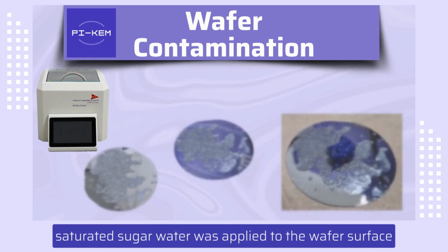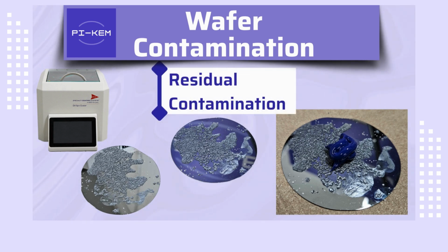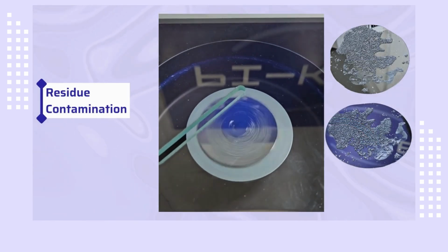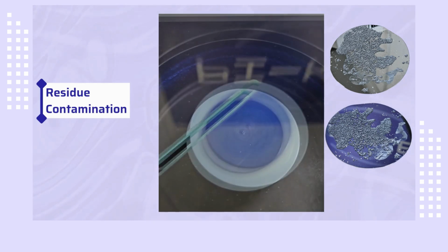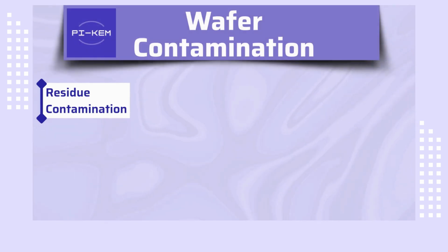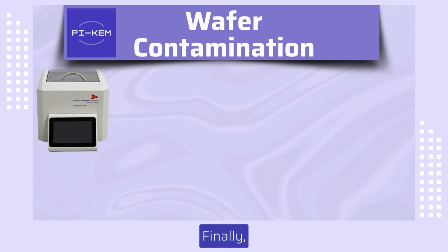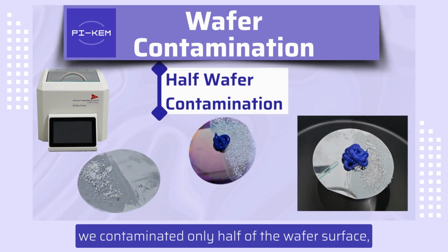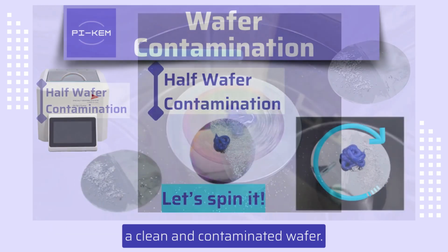Secondly, saturated sugar water was applied to the wafer surface and allowed to dry. This represents residual contamination of the wafer surface. Once again, we can see that the coating achieved is irregular. Finally, to really highlight the effect of wafer contamination, we contaminated only half of the wafer surface, allowing you to see side by side the difference between a clean and contaminated wafer.